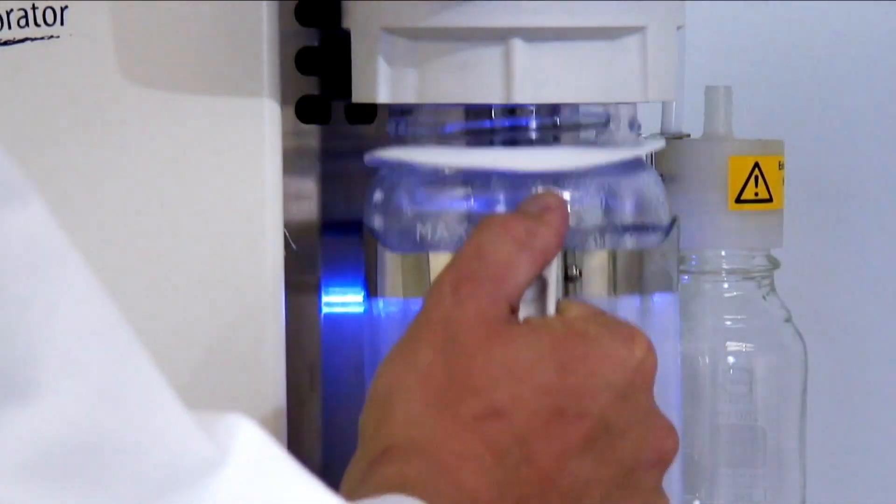When the system stops, open the lid and remove your samples, not forgetting to empty the cold trap.